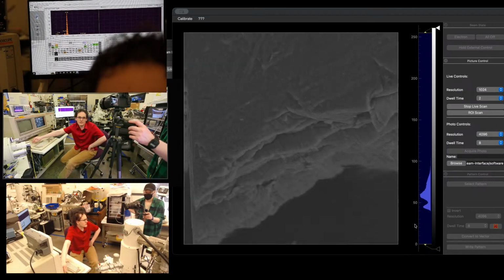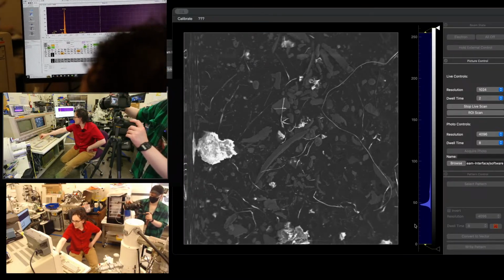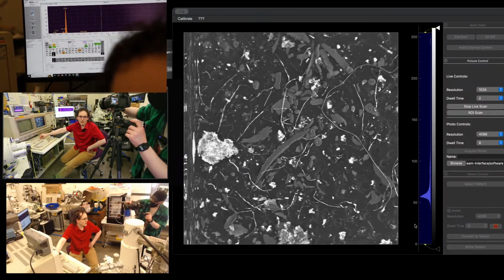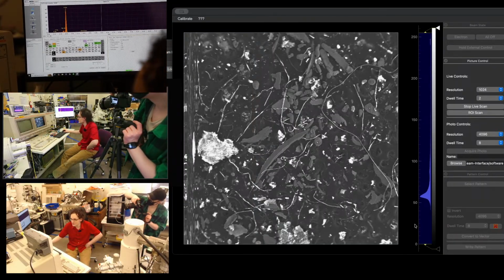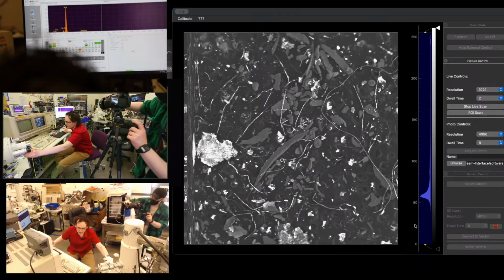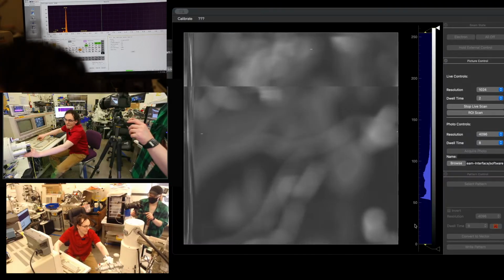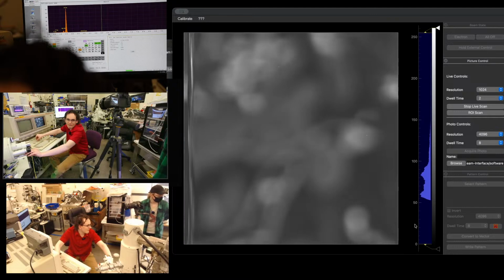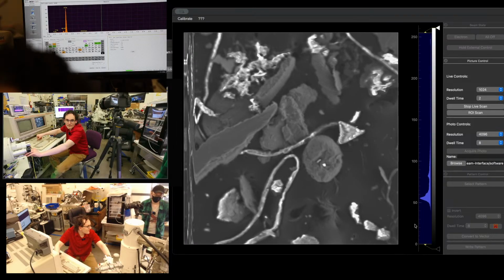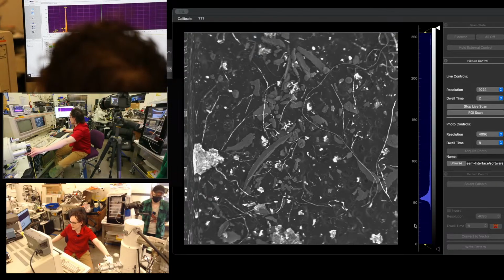Let's go ahead and zoom out some, and we're going to crank our probe current up. So a lot of probe current. So now we're imaging. We're hitting everything on the stub with electrons. Our working distance is a little bit low. I'm going to bring that up some just so we get a little bit more pointed at the detector. Zoom out, point at our whole stub. Okay, now we're right at 15.